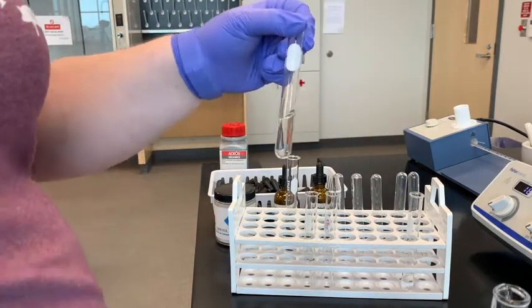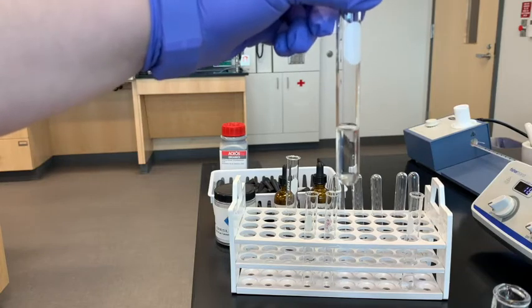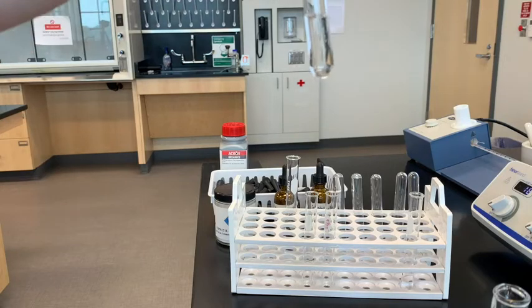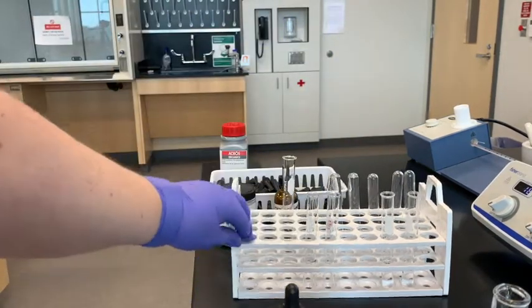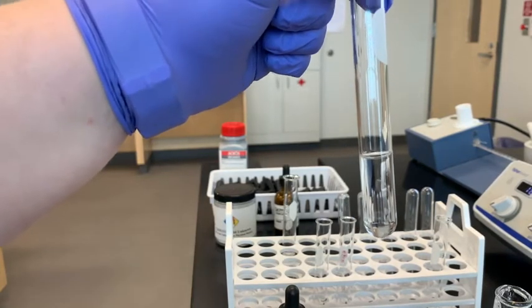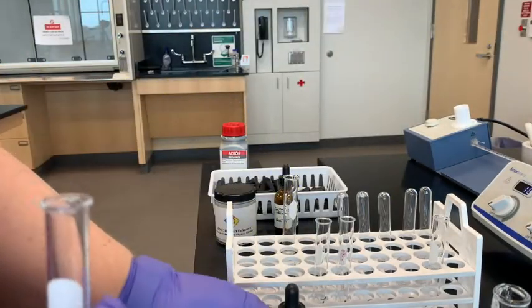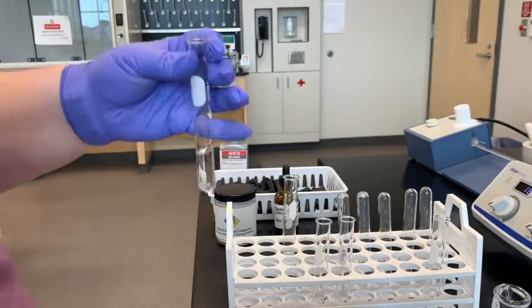In my first test tube I already have some of my unknown liquid. I want to test the solubility with ethanol first, so I have a little dropper bottle of ethanol. I have about two finger widths of the unknown in there, and I'm going to add about the same amount of ethanol. Then I'll put a stopper in my test tube and shake it up.